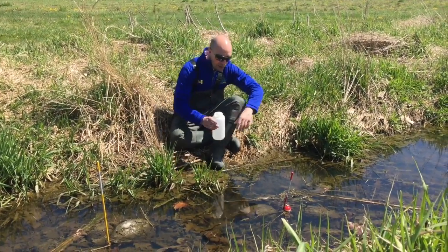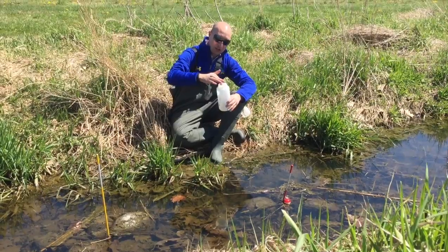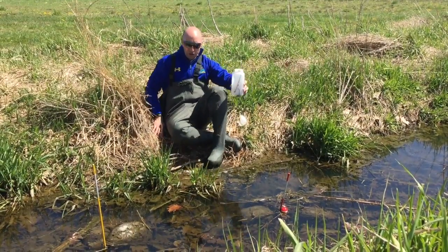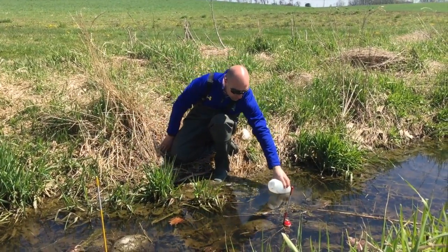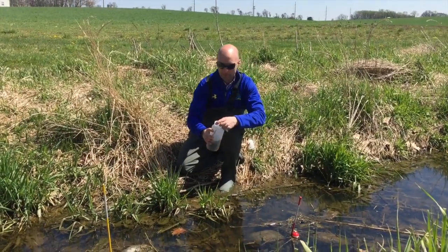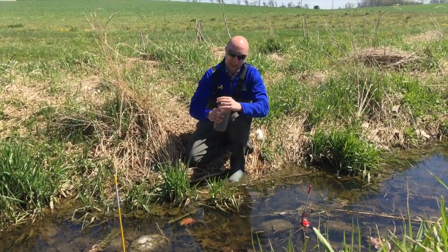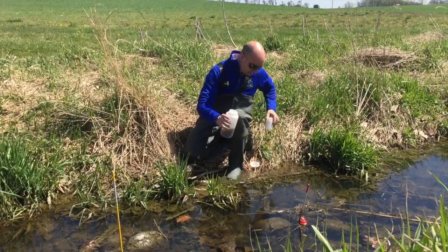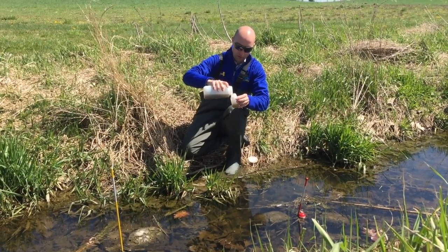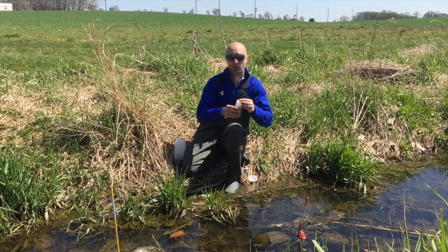Much like Site 1, you want to carefully collect some twigs and make sure you get some of that algae. You're also going to want to use a lot of surface water, so carefully without disturbing too much, fill your composite bottle. Shake it up again, then pour off the supernatant into your sample bottle, which you'll then take back to the lab for analysis.